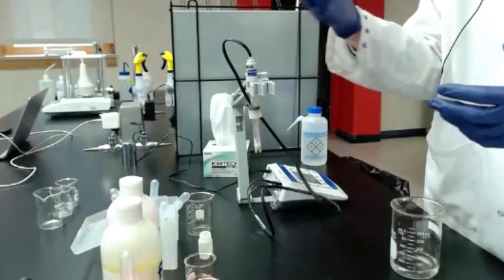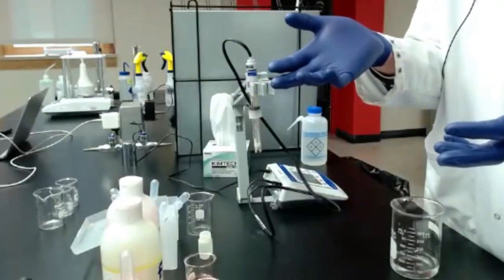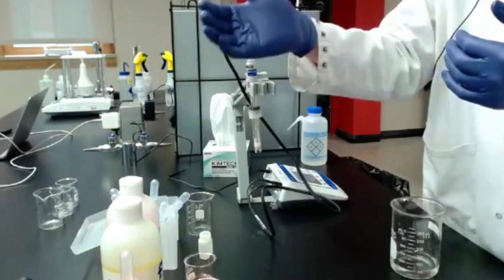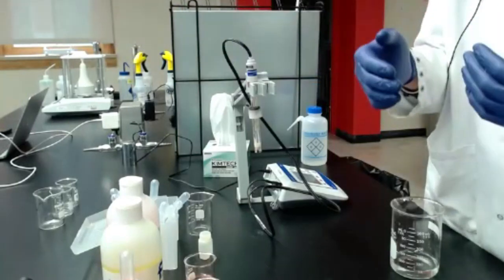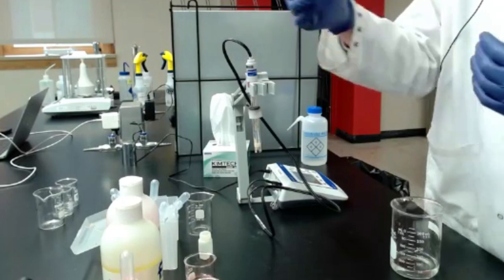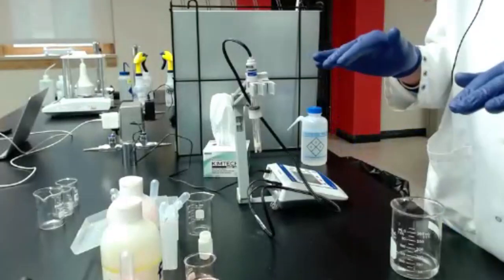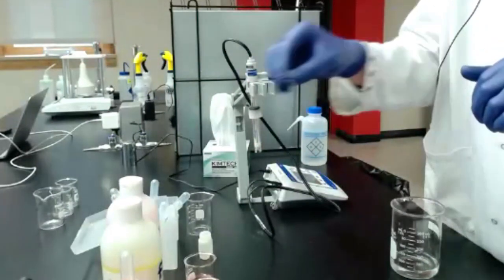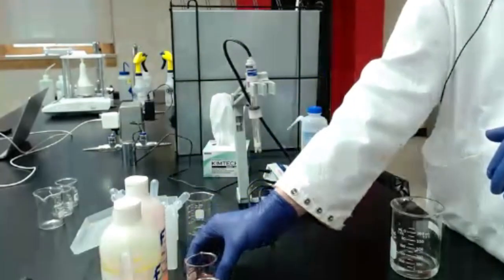So if I'm measuring something that's basic, like bleach, hopefully you're not measuring bleach with chlorine in your winery, but that's going to be on the alkaline or the basic side. They're going to have high pH values. I'm going to use different buffers to calibrate than I would for grape juice, which is going to have a pH of 2.5, depending on when you're starting your sampling, to 3.5 or something like that. So today I have 4 and 7. 7 is that neutral pH value. It's always a good idea to include that one. And then we're going to go below that into the more acidic range with pH 4.